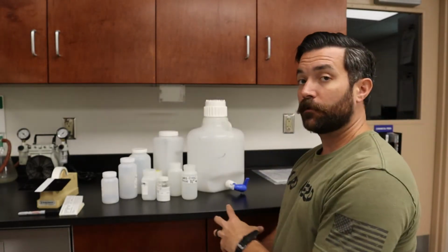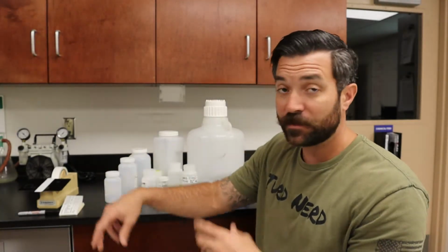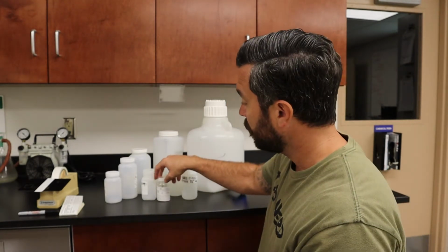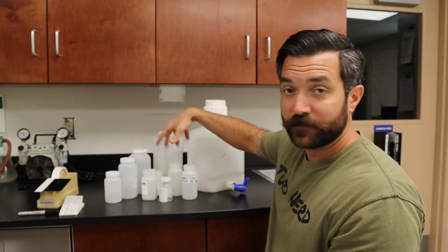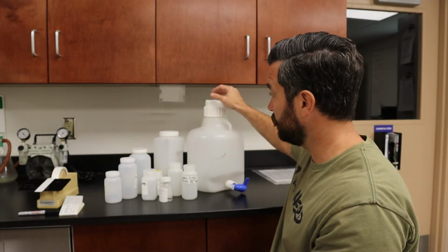Alright guys, so we're going to go over a couple bottles here. They're various sizes. There's nothing really special about them. There are some that I don't have on hand. Some are the glass amber color bottles. This is going to be the darker brown, and that's to protect it from sunlight, which is the reason why it's in an amber bottle. But these are some of the ones that we use here at our lab and are very common. These would just be general sample bottles, various sizes. You might call that a jug, you know. If not, I would just call it a sample container.